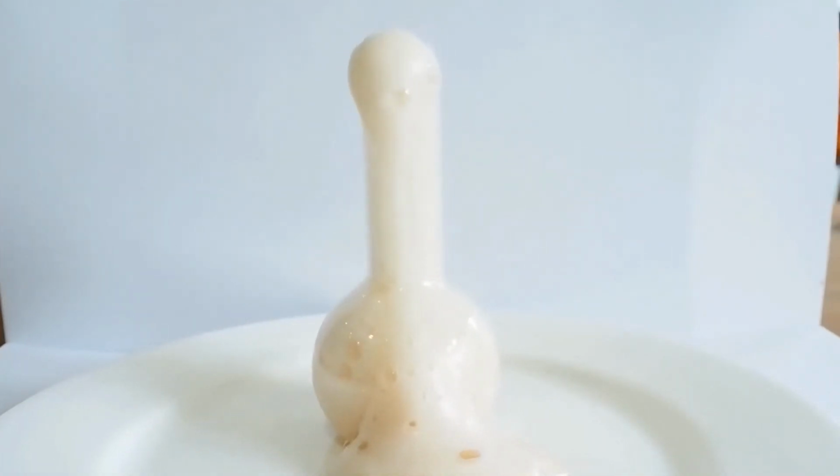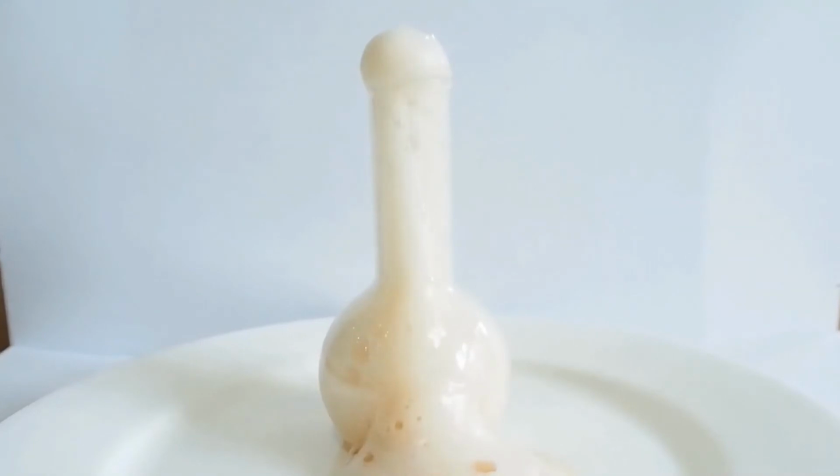So what's going on here? Well, we'll have to have a little closer look. So, what we had was some sodium bicarbonate in a beaker, and when we added our vinegar or acetic acid solution, it dissolved some of it up, and very quickly, wasn't it? It was incredibly much quicker than this, it foamed up. Lots and lots of bubbles and foam. So what was going on here?